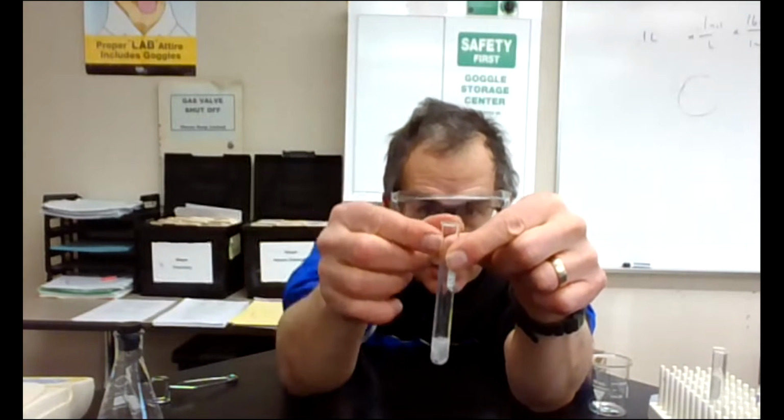I'm going to grab a clear solution of 6 molarity hydrochloric acid, put about 20 drops in here. I'm more of an estimate. I'm okay with that. And this is a clear solution right here. And then I will grab a piece of zinc metal. I will drop this metal into the hydrochloric acid.